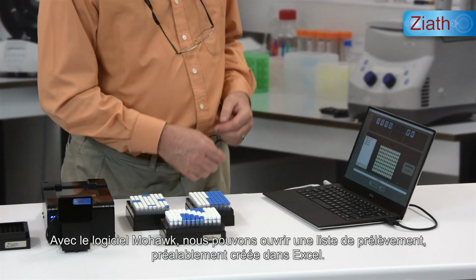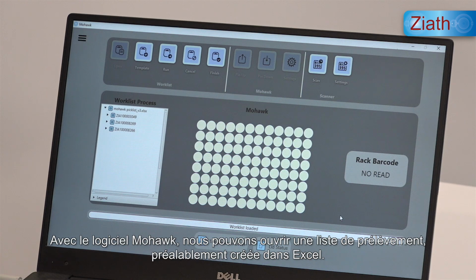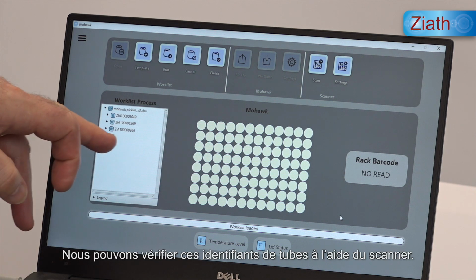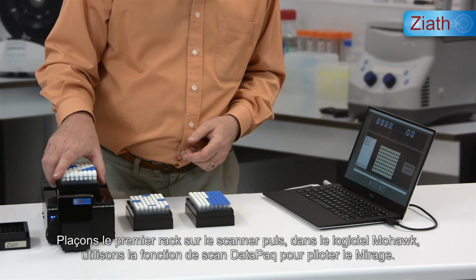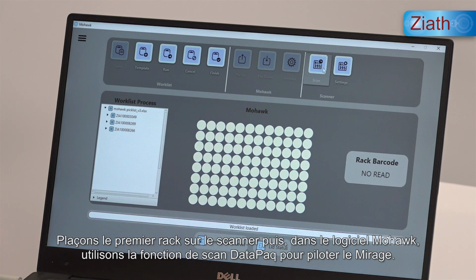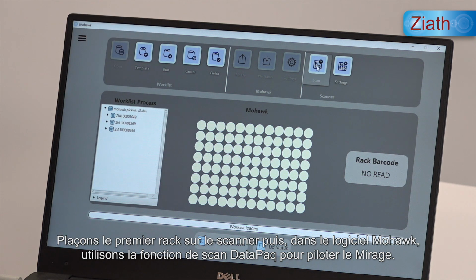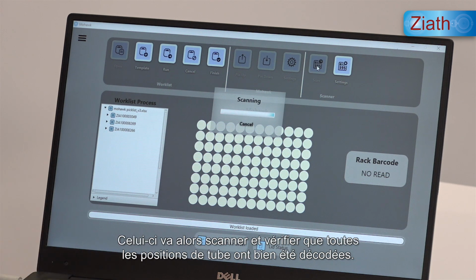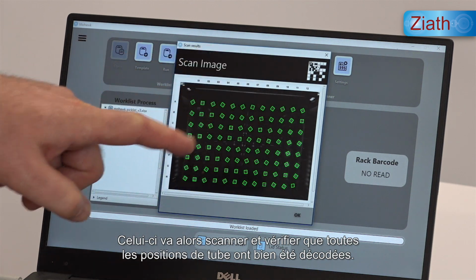Using the software, we can open a pick list which has been previously created, and we can verify those tubes using the scanner. So if we place the first rack, and then within the Mohawk software, we can use the DataPaq scan function to drive the Mirage. It's now scanning, and will verify all of the tube positions have been decoded.